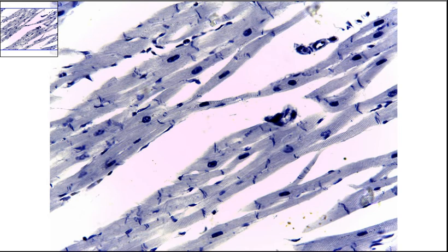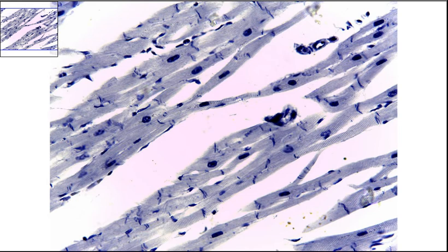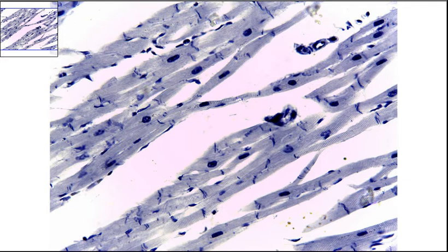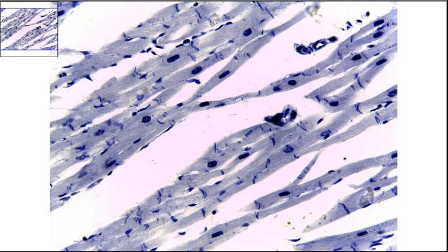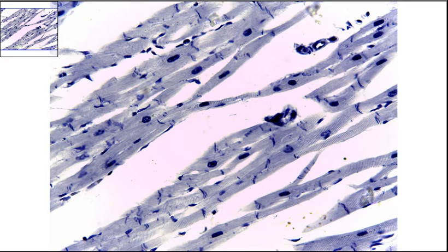This slide is cardiac muscle. The cardiac muscle is found in the heart. The current magnification is 400x total magnification.